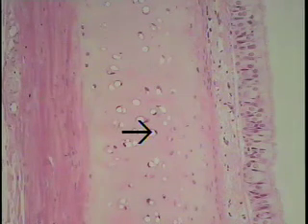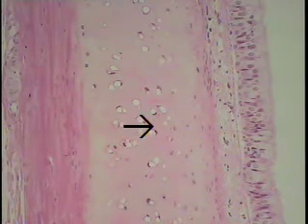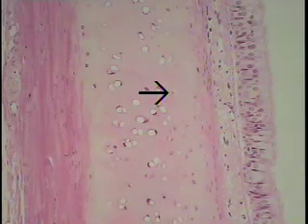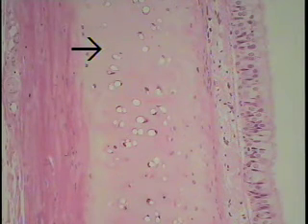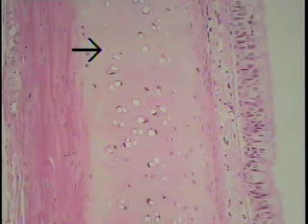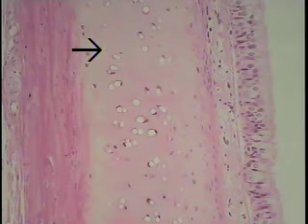Some chondrocytes look like they've been blown up or have died during processing. These small cells, the chondrocytes, reside in small spaces within this dense extracellular matrix known as lacunae. So each of the cells resides in a little space or container known as a lacuna. Let's briefly examine each of these substructural features at increased magnification.